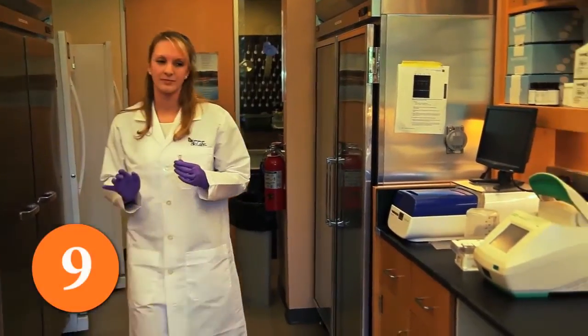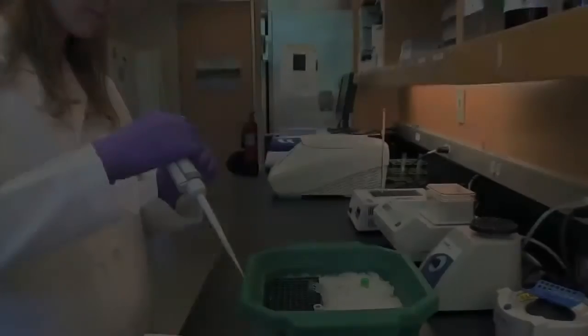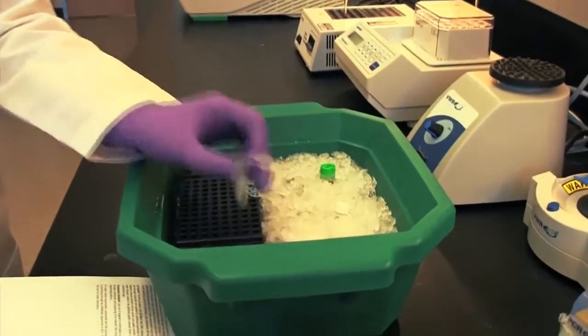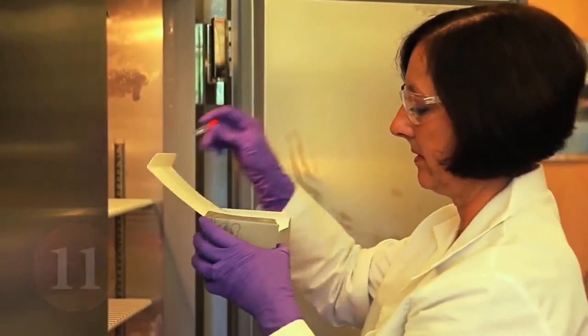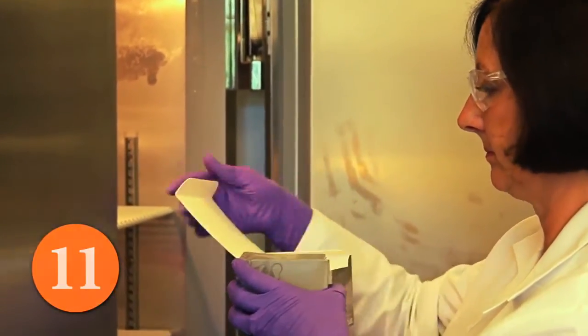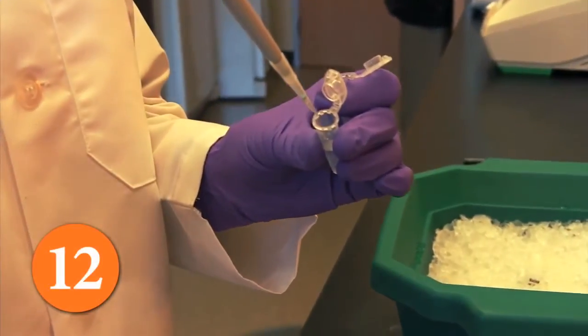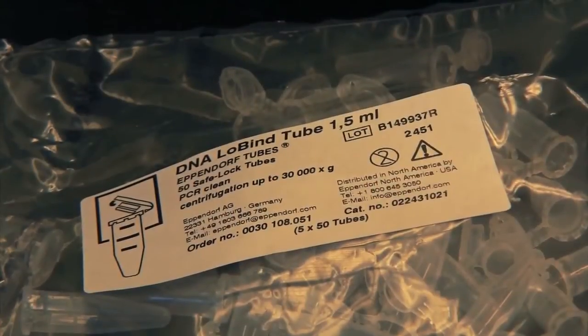Thaw and keep all master mixes on ice to ensure optimal activity. When mixing reagents before addition to your reaction, keep everything on ice and use immediately after mixing. Be sure to return enzymes to the freezer after use to ensure product stability. To ensure the stability of your final library, store your samples in TE buffer and in low-bind DNA tubes.